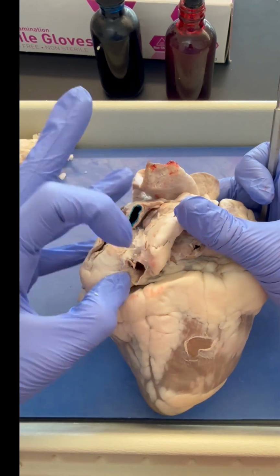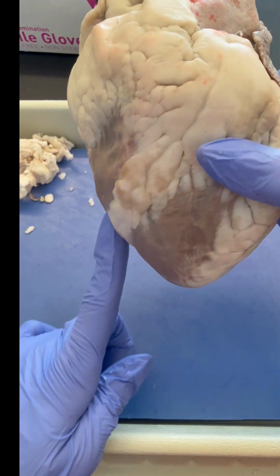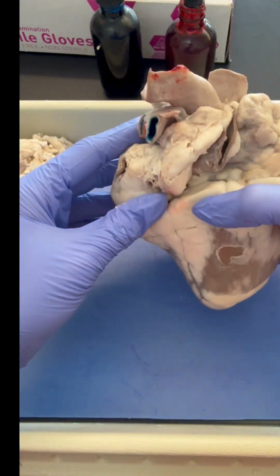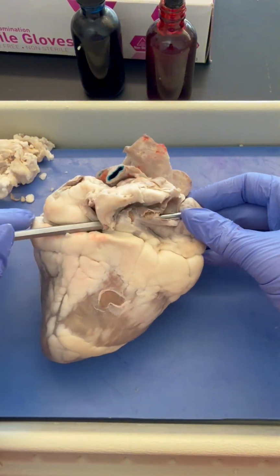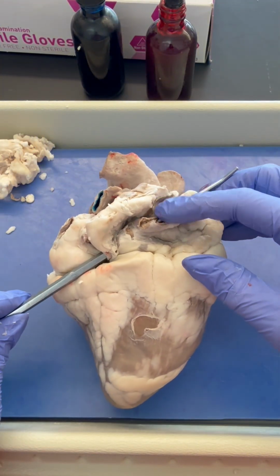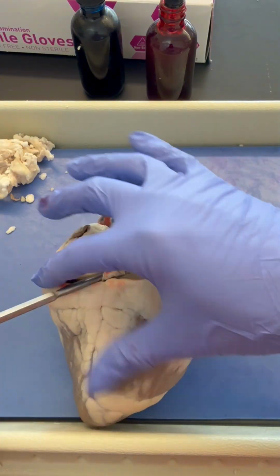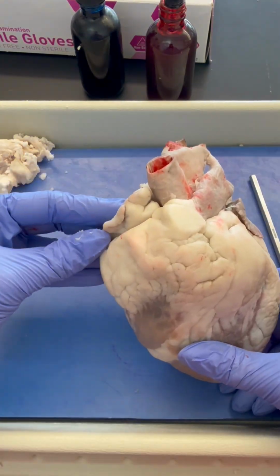And then I also see this tube back here. In diagrams, you sometimes just see in a two-dimensional structure the inferior vena cava looking like a tube back here. But you can see where that tube has been cut off. Okay, here we go. So we can see the superior vena cava here, inferior vena cava here, and we know that both of these tubes are leading to the right atrium, being right here.